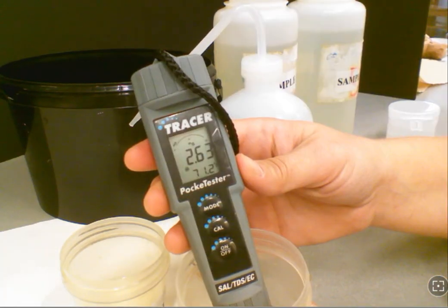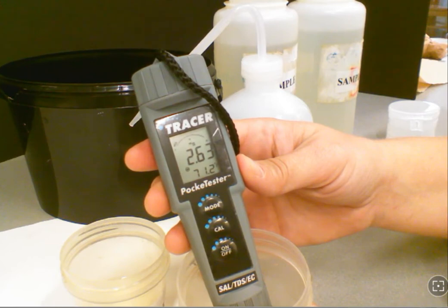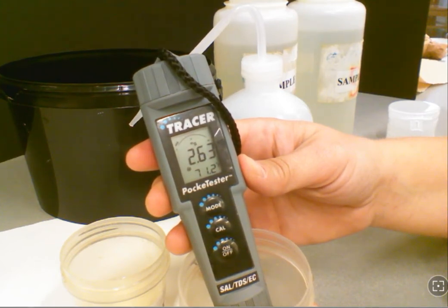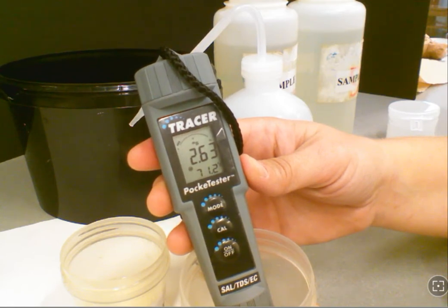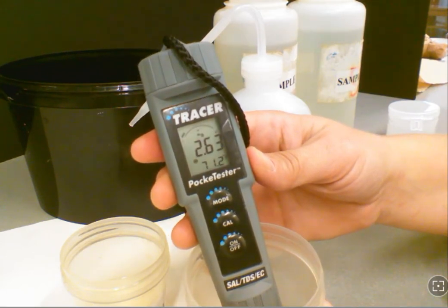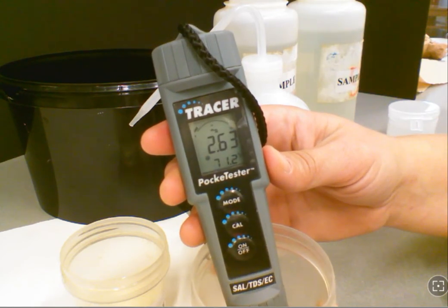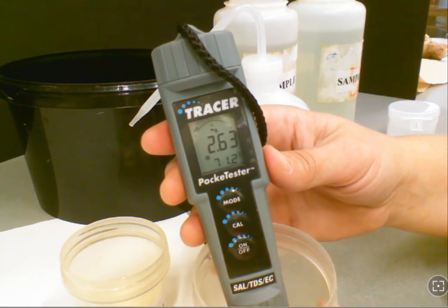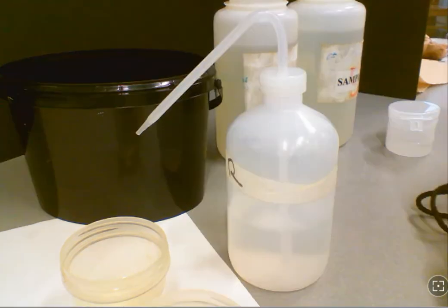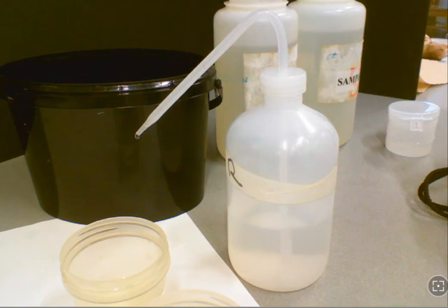Just a reminder: if you're taking a sample, µS is the normal reading you would get. But in the event of some sort of contamination, it might switch to millisiemens. If you notice the unit changes on your meter, please note that and mention it to your instructor when you report the data, because that could lead to further investigation and other issues. Please be sure to clean your probes once you're finished testing. Thank you.